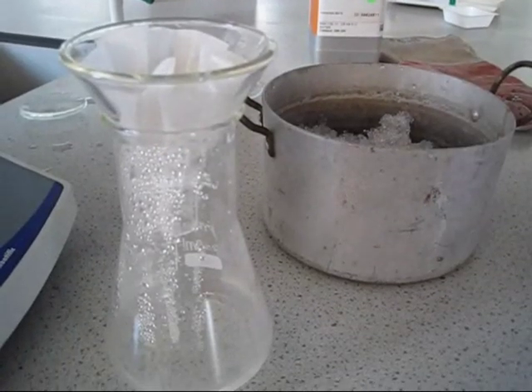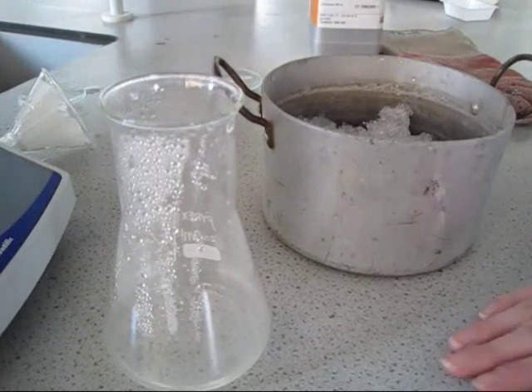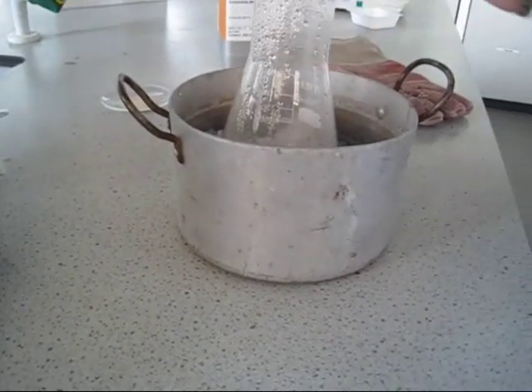Once we have finished the hot filtration, we can leave the conical to one side to cool and the crystals will start forming. However, by placing it in an ice bath this will accelerate crystal formation.